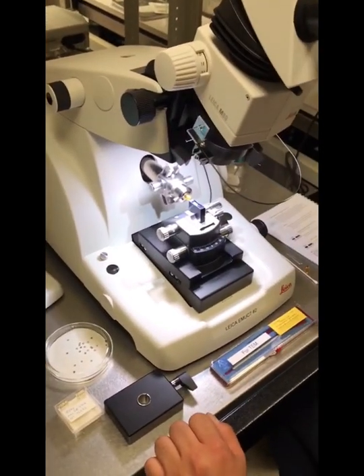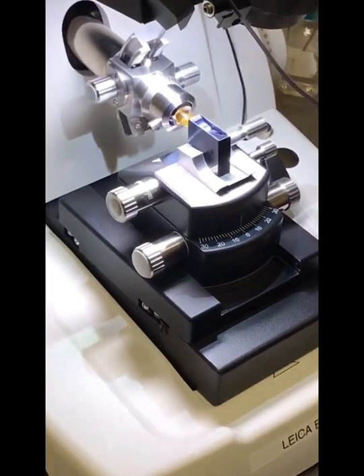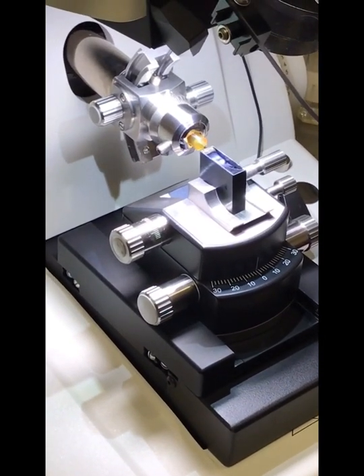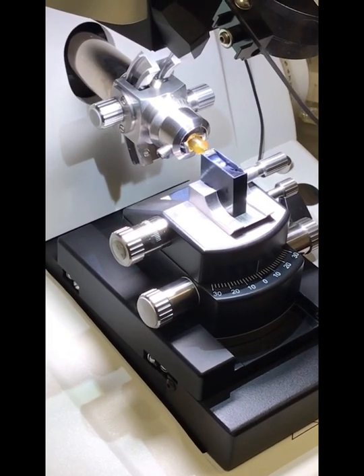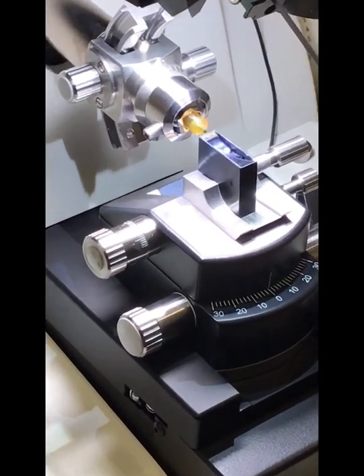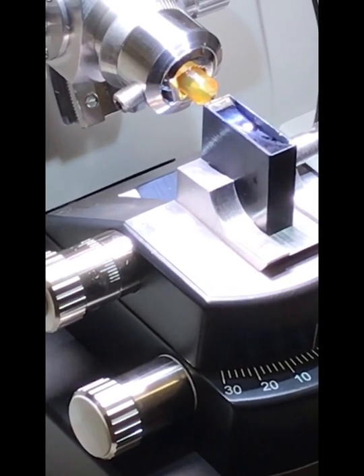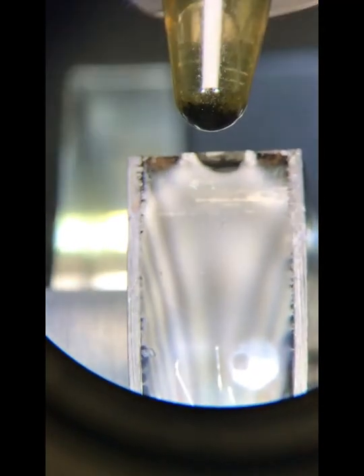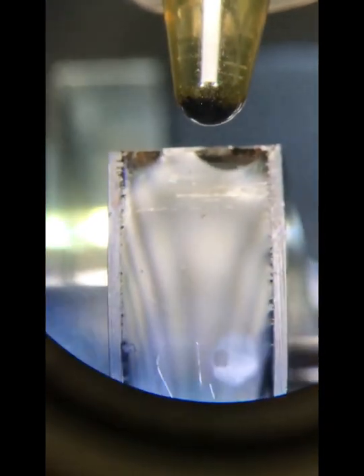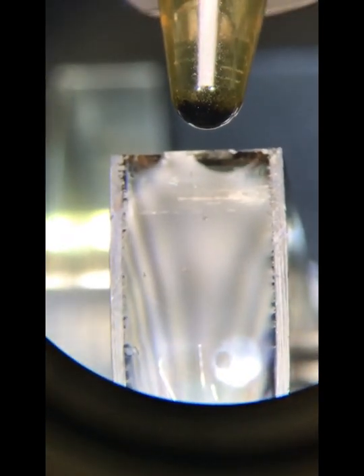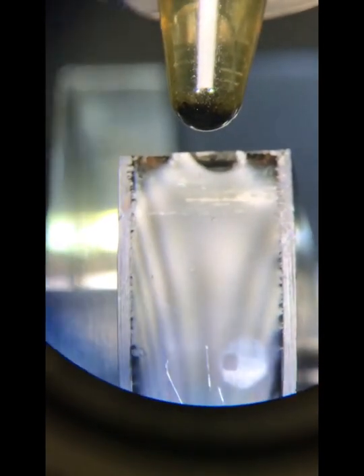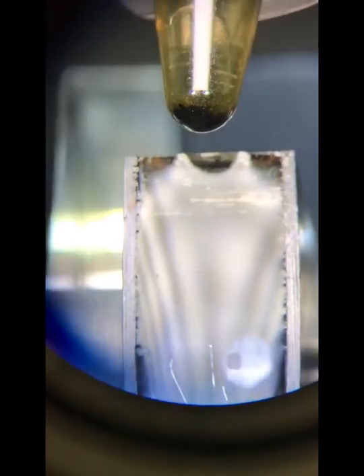Press start on the automation. As you can see, it's following the cutting window that we preset. The east and west fine movement will adjust your knife in the east and west direction along your sample so you can find a good area on your knife and be at the right position.